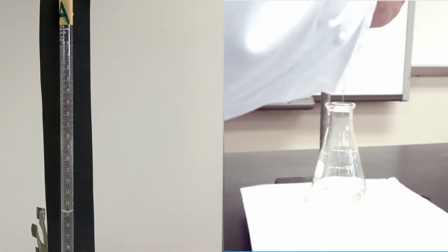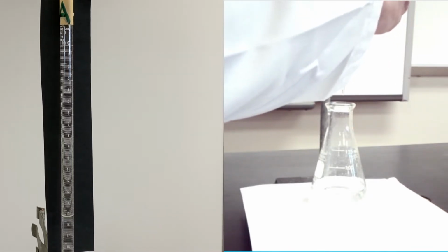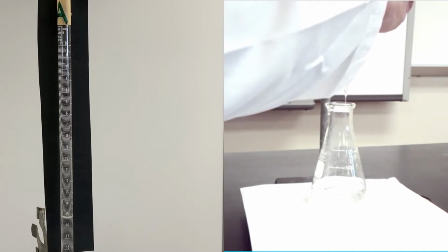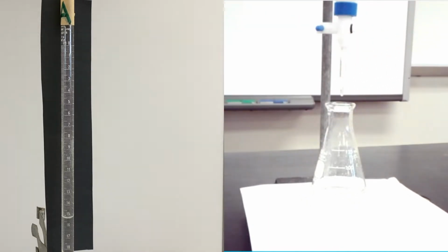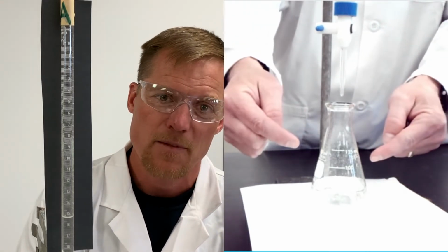And to make sure that I am right at 15.3, I'm going to get about eye level, and I think I hit it right there. So let me get a better look. I got 15.1, 2. I might have to go down another milliliter, but that's okay. It doesn't matter. Even if I overshoot, and let me see if I can just get it to drop one more. Even if I overshoot, it doesn't matter because what matters most is that I know the exact volume that I'm putting in here, okay?